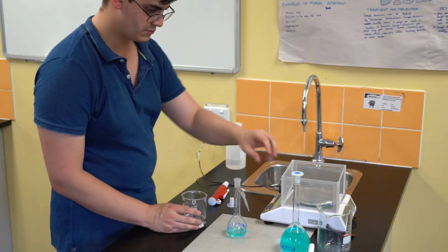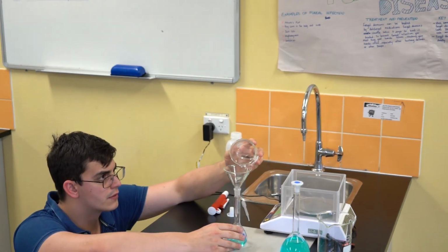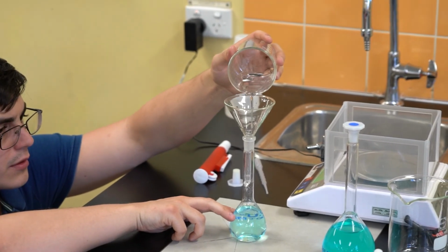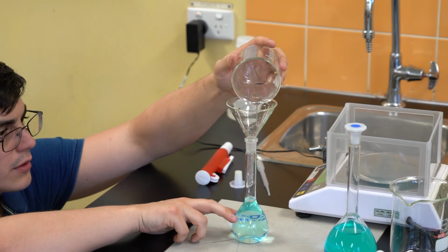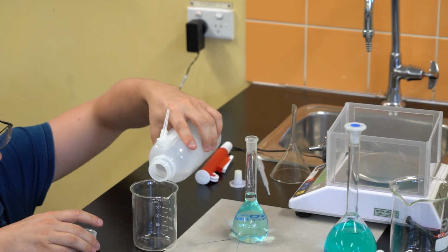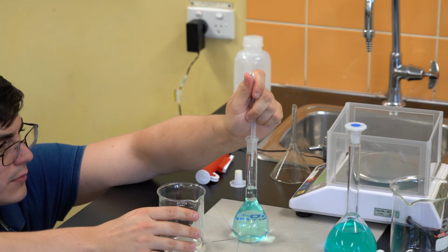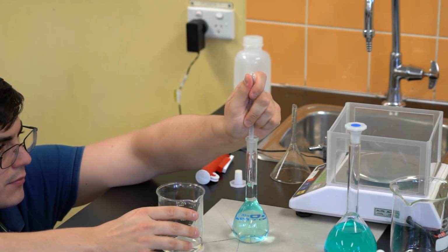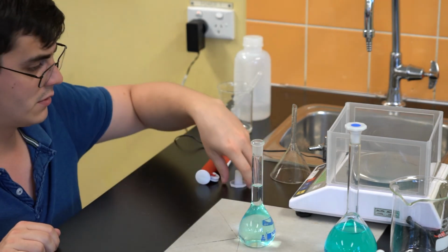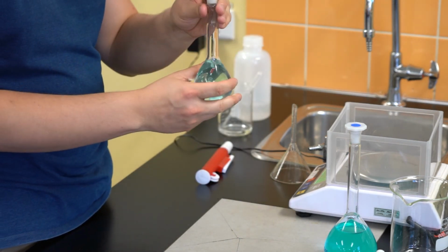Similar to when we were making a standard solution, the last thing that we then need to do is actually fill the flask to its etched mark. So that will require me to first pour some liquid in. I'm going to stop at about where the neck begins to curve in, and then for the remainder, just transfer the last part of distilled water using a transfer pipette, adding 1 drop at a time, ensuring that the meniscus, or the lower part of the meniscus in particular, lines up with the etched line on this 100 mL volumetric flask. The last thing to do is cap the flask and invert a few times to ensure that the concentration of the solution is even throughout the flask.